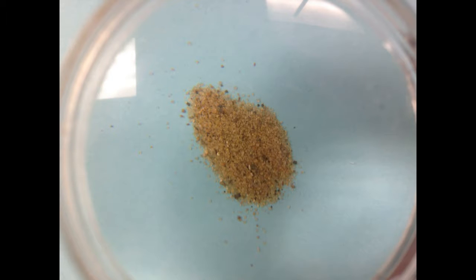Here is the sample of sand under a magnifying glass. Again, make any observations and draw the particle picture in another third of your particle picture box.